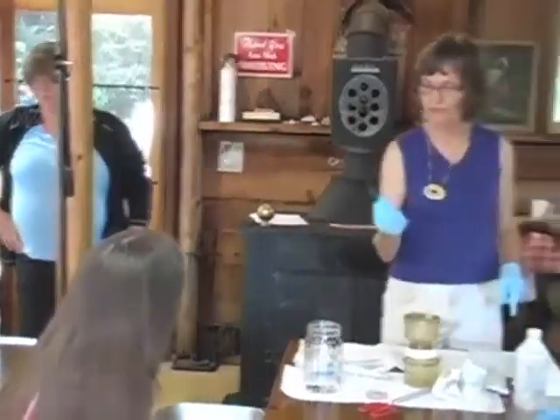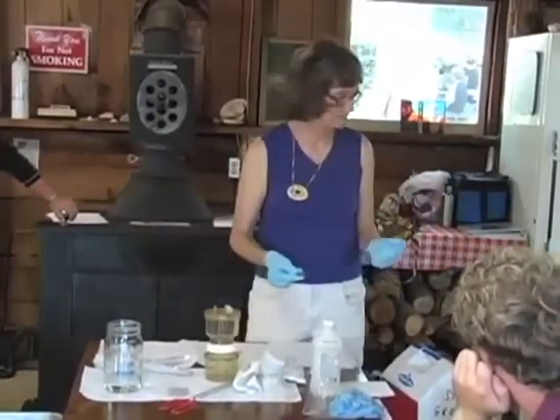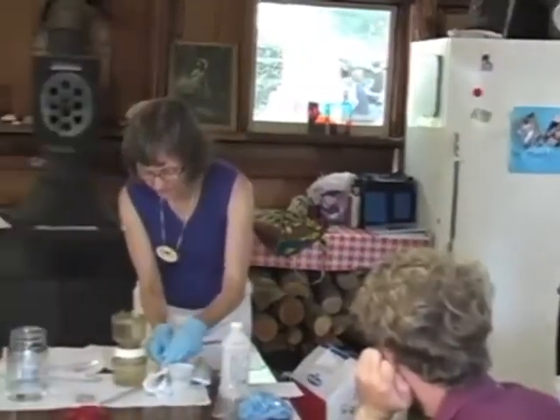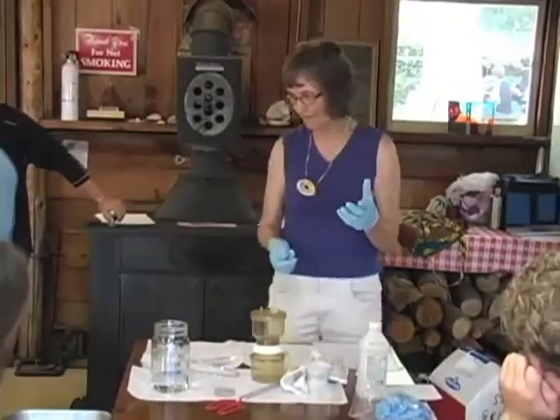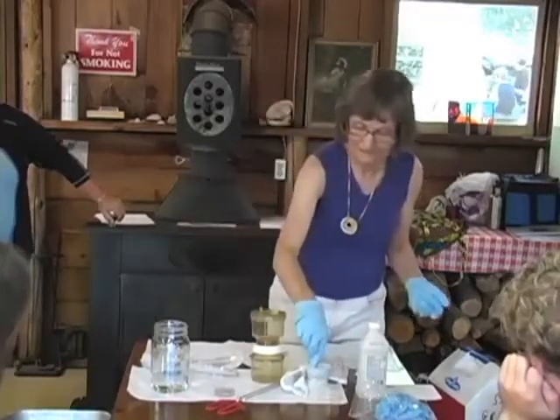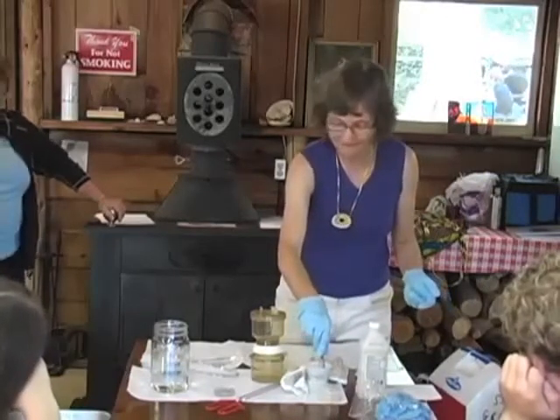Okay, now these were pre-sanitized, but I think it says to sanitize them anyway in alcohol. Sanitize forceps, tweezers with alcohol and flame of lighter. And we're not using flame today because I didn't get a lighter, but there's been some question about whether that's really safe for students anyway, going alcohol and then flame. But it's way cool. In 20-some years, nice blue flame.